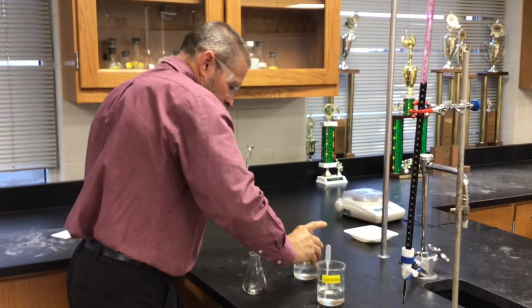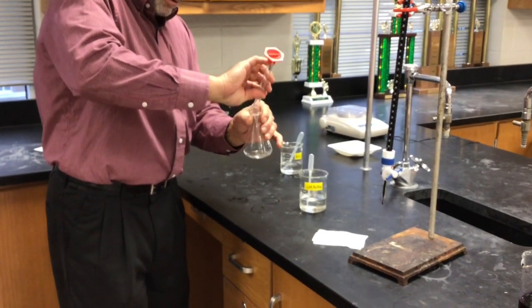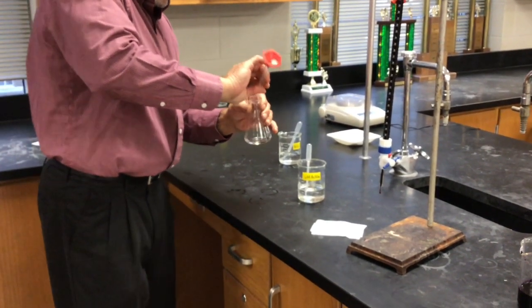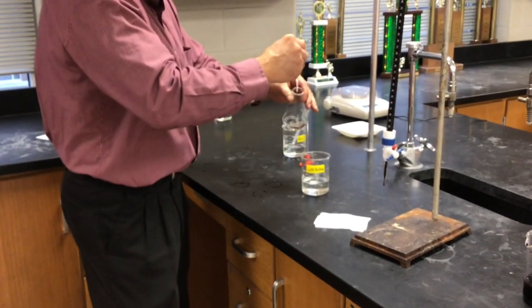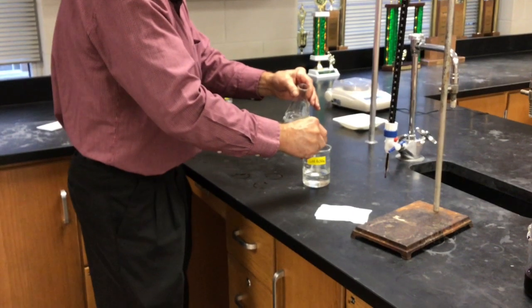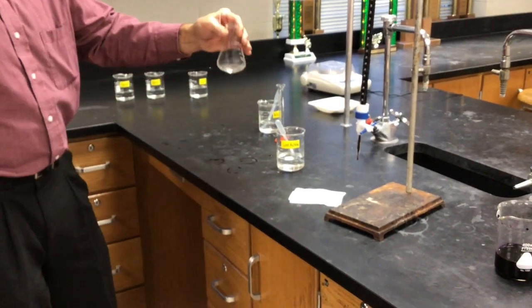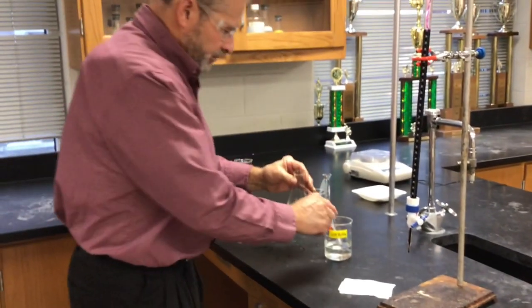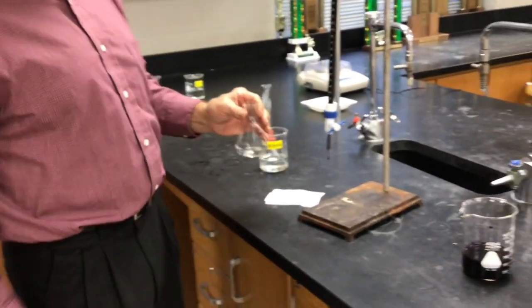Okay. Got our peroxide measured out. Acidify it. There's no reaction here with the peroxide and the acid. You've got an acidified peroxide solution right now. Okay, are we ready?